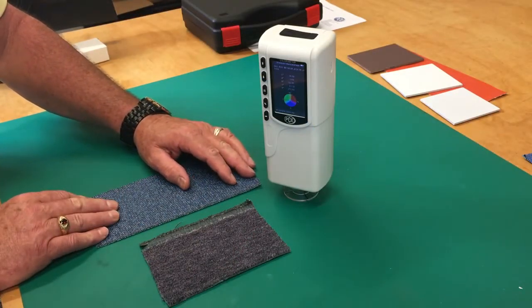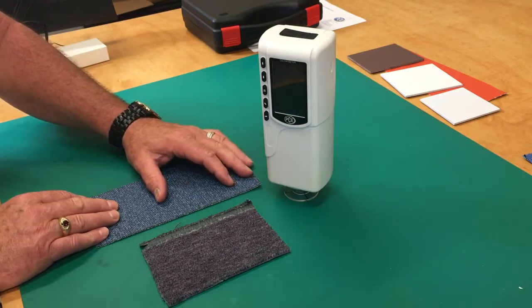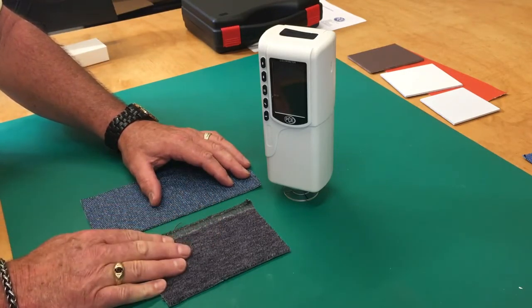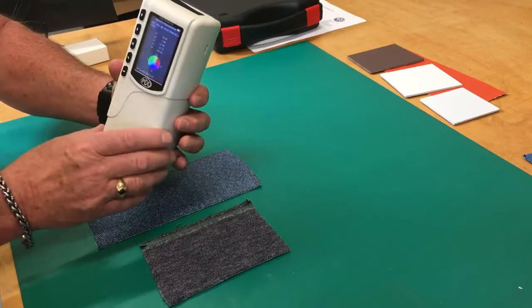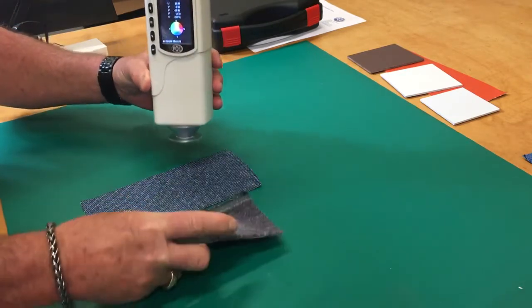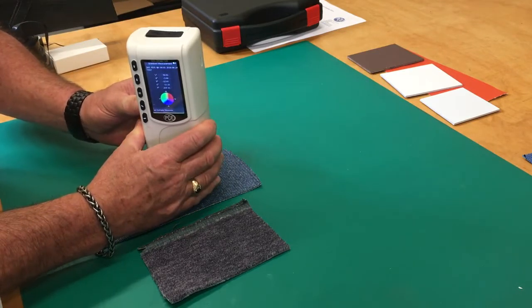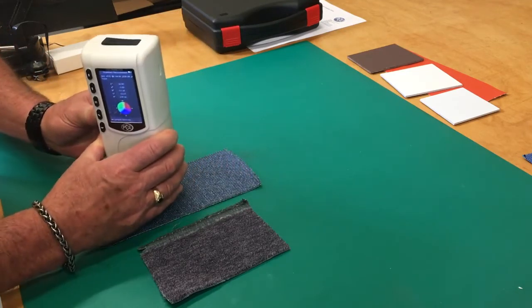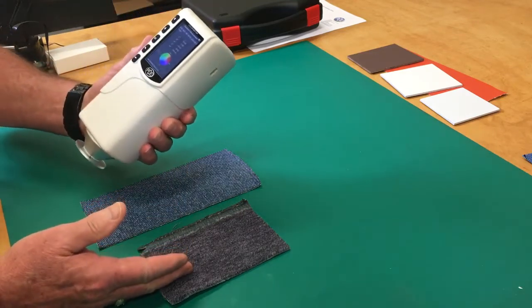We've been using this color fabric for a customer on his furniture, and now he wants a new batch of furniture. So we have a new shipment of color that came in. We're going to check this fabric color against this fabric color. They look about the same, but we're going to make sure. So we set this here and we take a reading in several places.